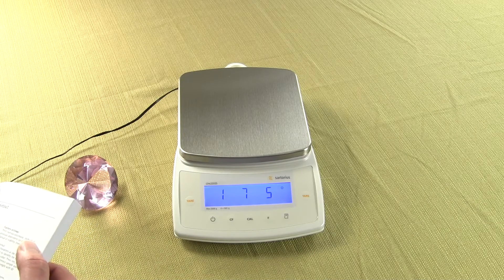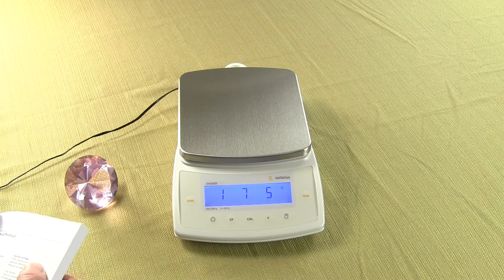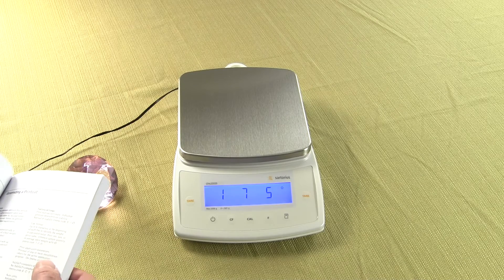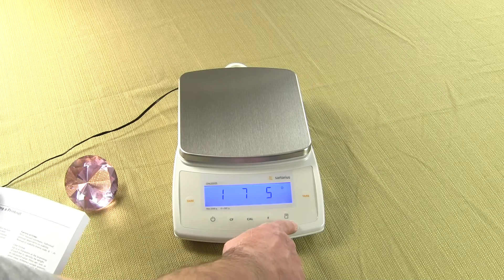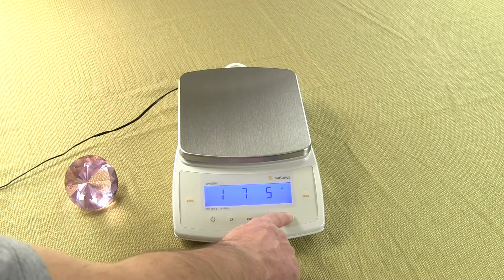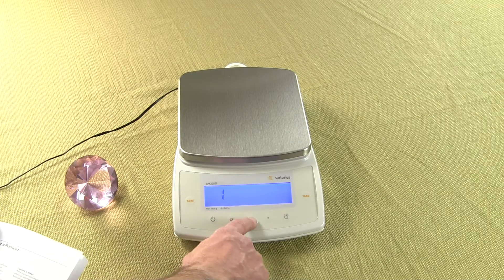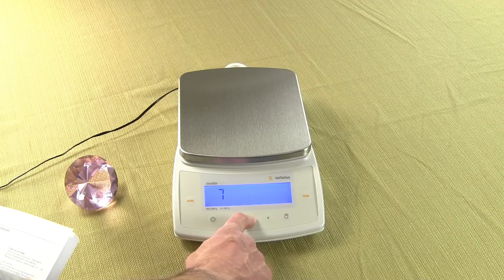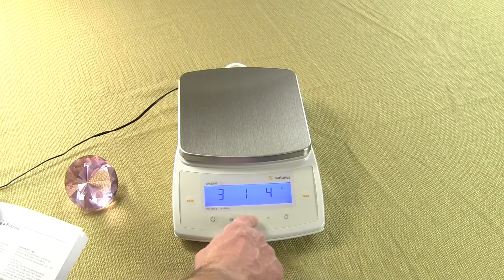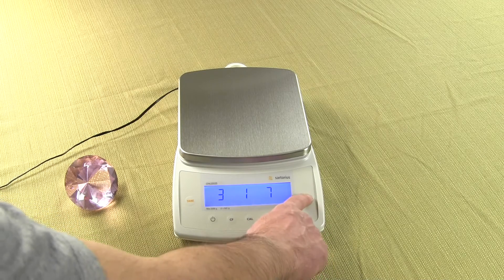We have the circle in the upper right-hand corner — we know it's stored. Now on our secondary mode, let's change that to troy ounces. In the manual, that code would be 3, 1, 7. So we need to move the cursor over — press the Print key. We have a 1, need to set this up to 3, 1, 7. Press the Cal key, increment up to 3, 1, 7. Store it by pressing the Print key.